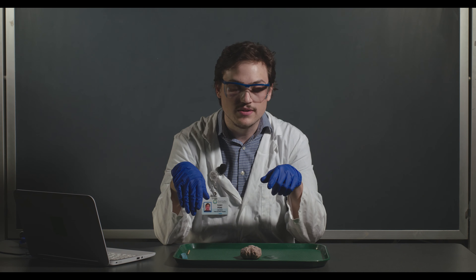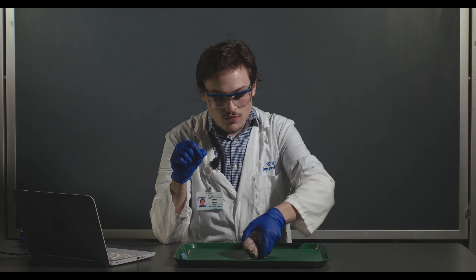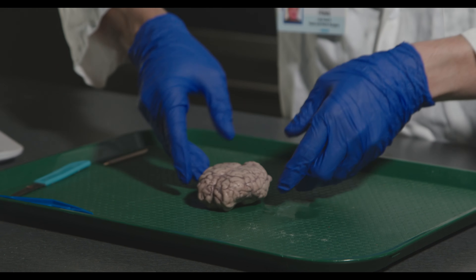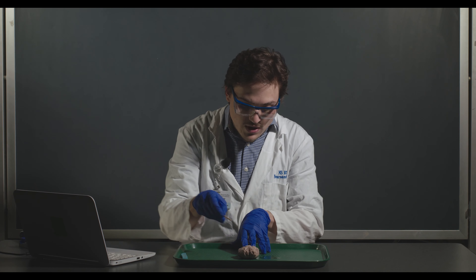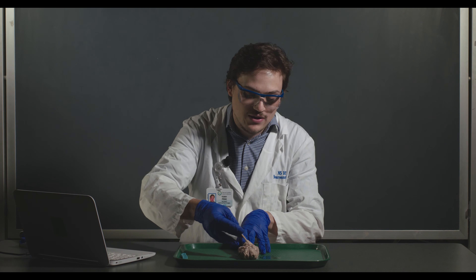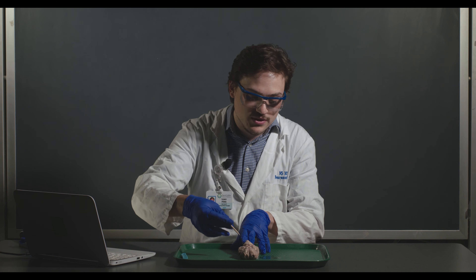One thing you'll notice is the difference between the sheep brain I have here and the one in your lab manual: the lab manual brain still has the dura mater, which is the outermost, toughest layer of the meninges — those protective outer coverings of the brain and spinal cord. You can tell there's no dura mater here by comparing it to your lab manual. Another indicator is on the ventral surface, where the pituitary would normally be — it's encased in the dura, so when that's removed the pituitary often comes off with it.